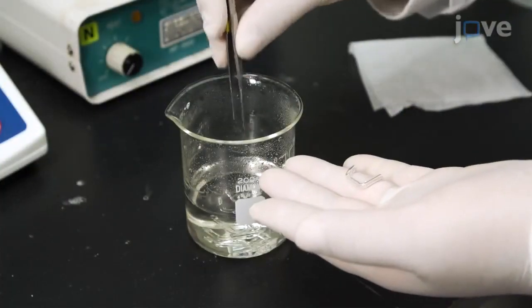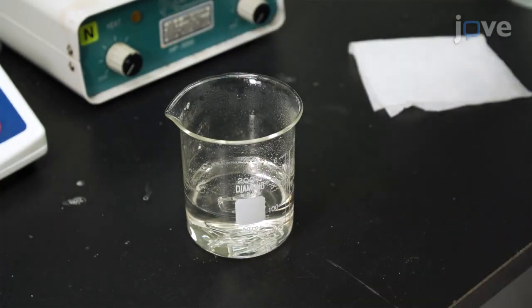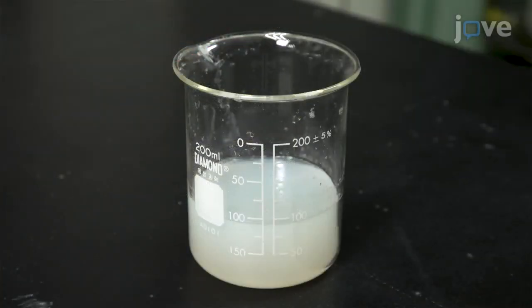Then, load the bridge with the potassium chloride agarose by immersing the glass bridge in the solution. Keep it overnight at room temperature for the agarose to set and harden.